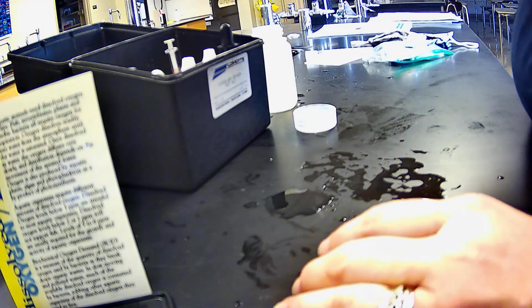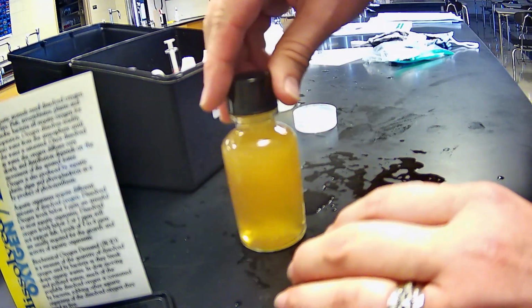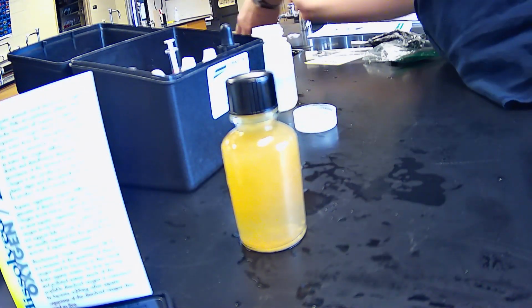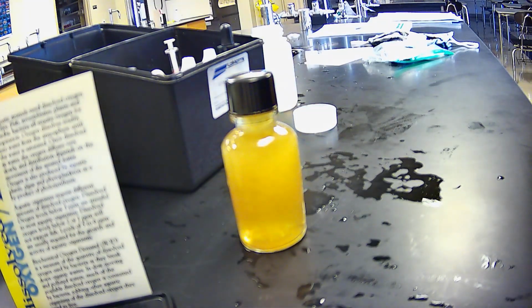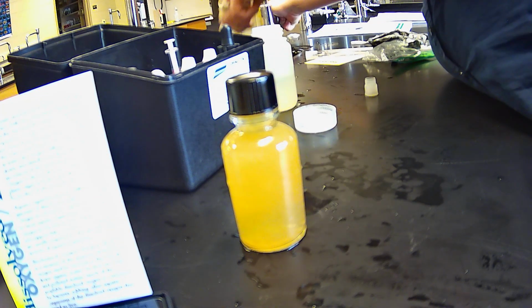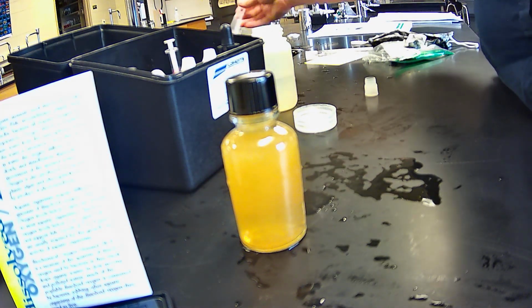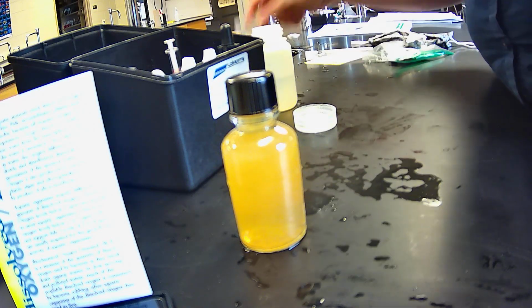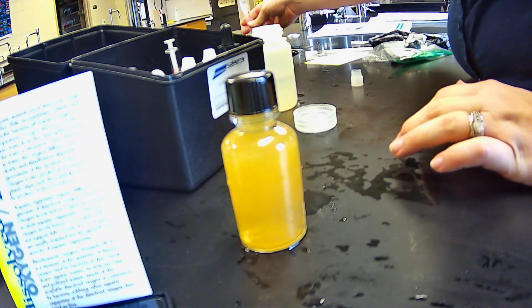All right, note, you should probably wear gloves with this. Definitely don't do as I do. All right, and we have to wait on that one, so while we're waiting, I'm going to clean these up. Again, if you're putting any chemicals down the sink, these are very small samples, that's fine, but let's run plenty of water to just ensure that we're not putting too much, kind of a dilution to the pollution here. So we don't want to cause any mishaps.